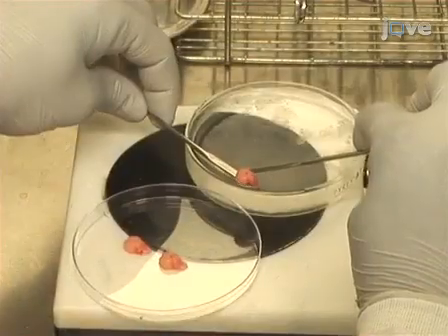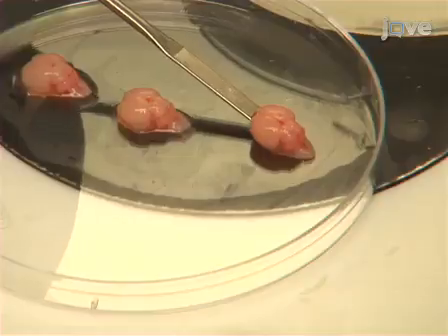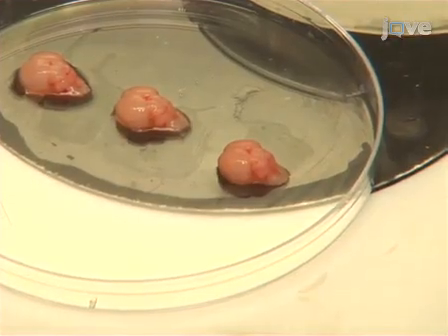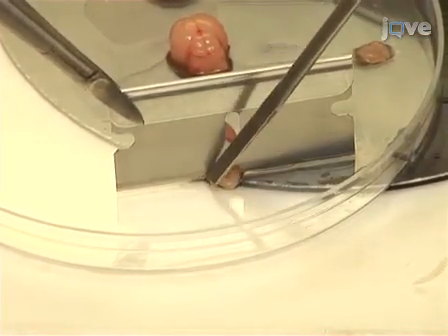To obtain VTA tissue, transfer the brains onto a sterile dry petri dish using a small spatula. Remove any excess fluid by gently sliding each brain sideways about 1 centimeter. Then, use a razor blade to remove the brainstem by making a coronal vertical cut at the level of the cerebellum.